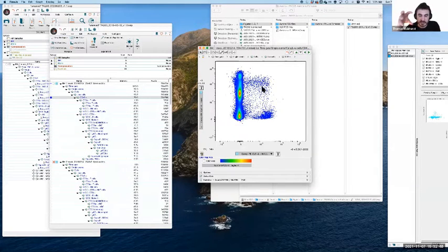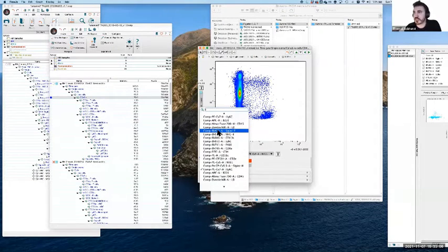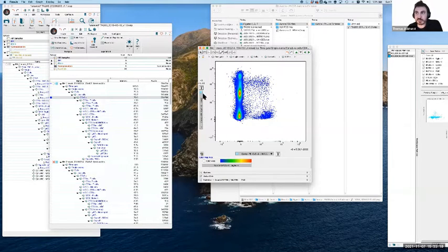We're integrating signal data from multiple detectors and turning them into one, let's say, synthetic or virtual detector. So what you end up with is a series of detectors, even though we've got, say, this is on a 3 laser, so not 64 detectors. Rather than seeing each individual detector that the Aurora has, we end up with a consolidated virtual channel, which represents the single fluorophore. As a result, we can view, in this case, PE-Cy7, Ly6C versus PE-Cy5, NK1.1, almost as if it was made on a conventional cytometer.